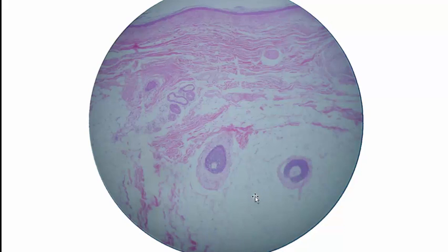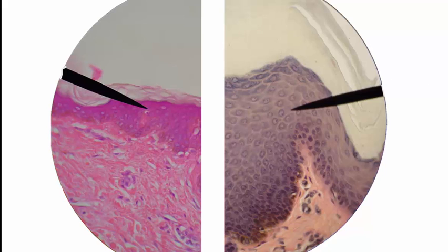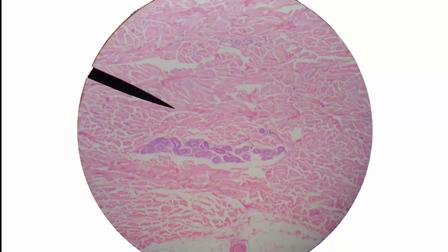And then what's down here? Subcutaneous tissue. What is this structure here and this one over here? The answer is hair follicle. What is this? Answer to that is sweat gland. Let's bop around here and do some other questions.